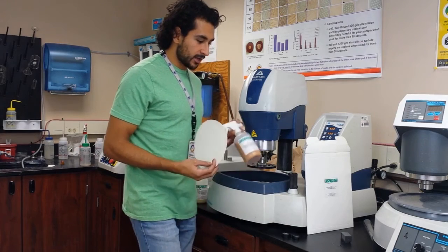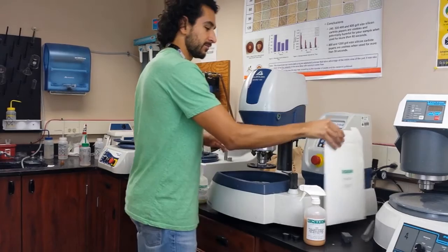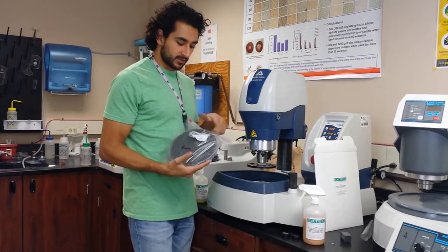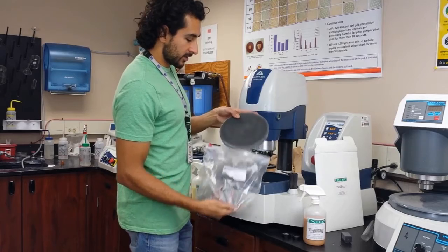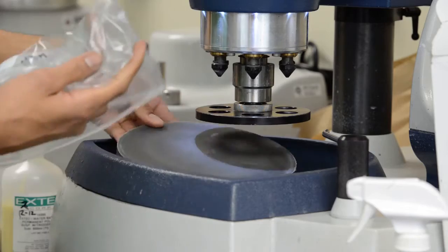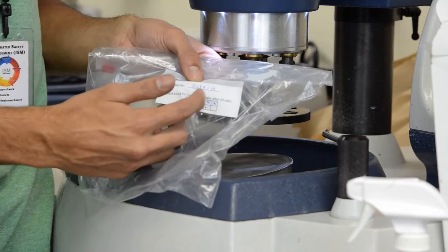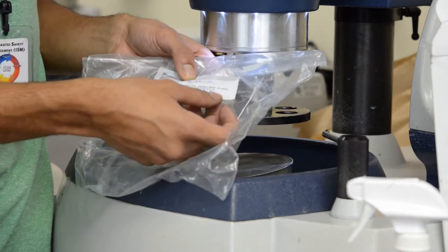We're going to use these two together. Notice these pads are very white, very clean. They get dirty quickly, but if it's dirty, it doesn't mean it doesn't work anymore — they work for a long period of time. I put them in separated Ziploc bags to avoid contamination and label them. I've labeled this one 6 microns, and it has its own disc. I put little labels on noting when it was first used, and for every five minutes of use, you mark one of the boxes. After 10 uses, you can discard it.